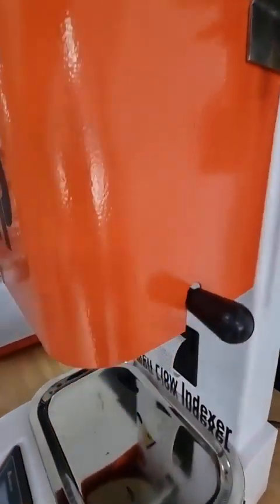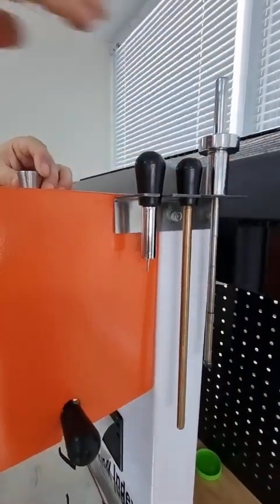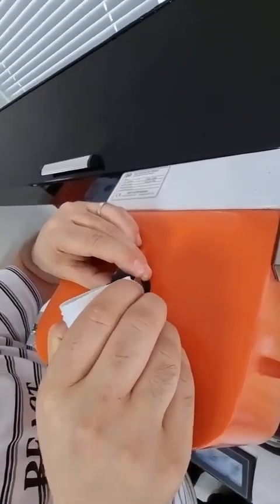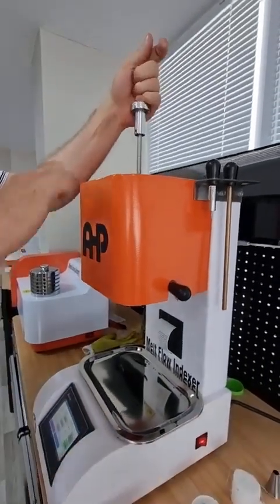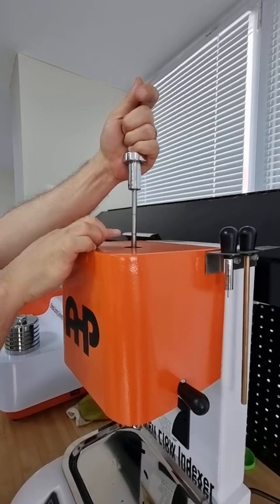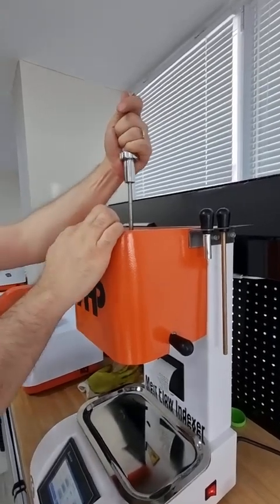To prevent the hopper from being blocked with granule material, fill it very slowly. While filling the material, push it down to remove trapped air from the granules, then fill again. There are two markings on the piston — the bottom marking on the piston needs to be higher than the top section of the cylinder. The measurement must always start when this marking reaches the top of the cylinder.